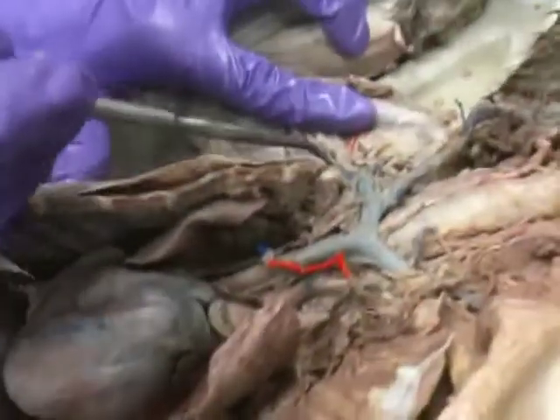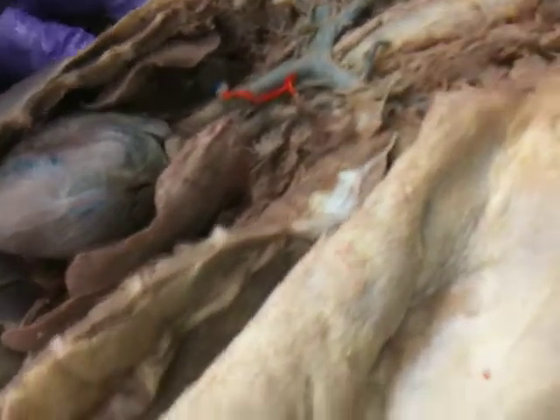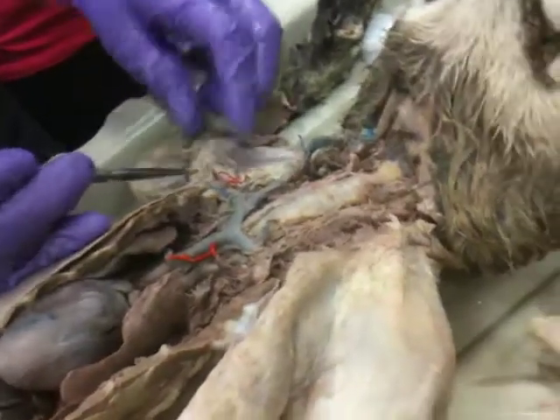And then that portion is the axillary vein, and then if you follow it all the way to the arm, that portion there — that is not cleaned yet — that is the brachial vein, the right brachial vein.